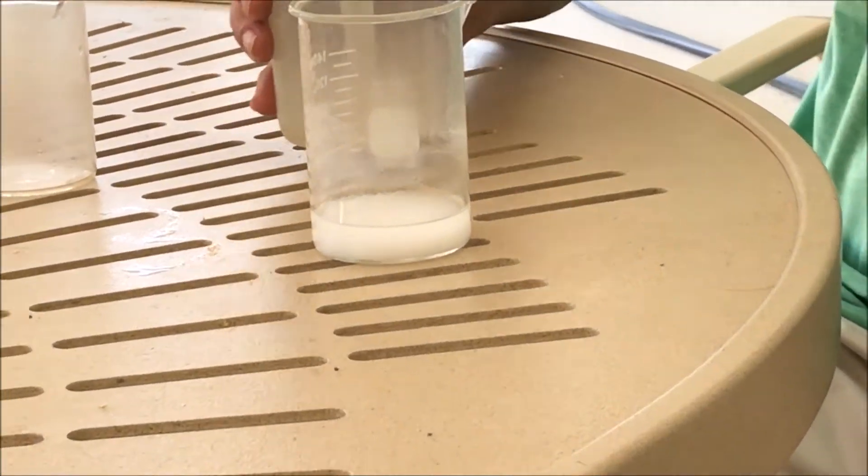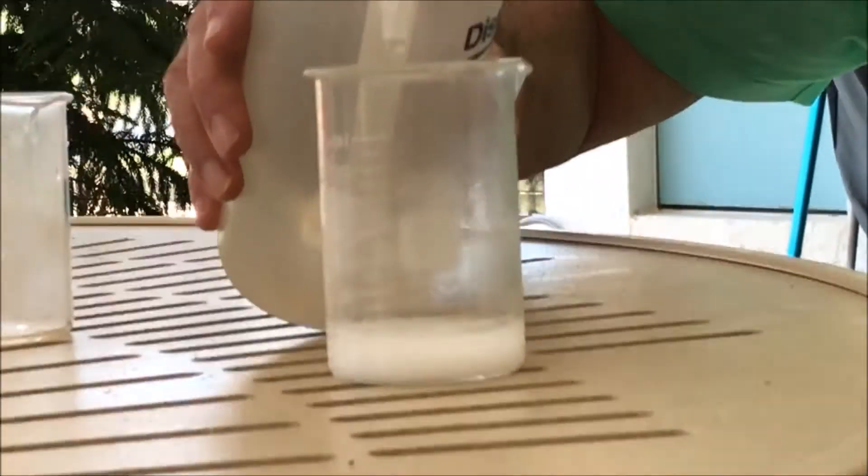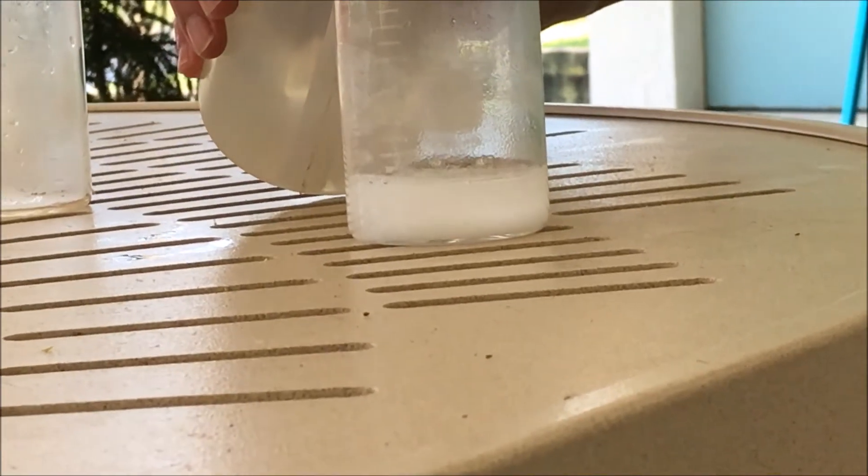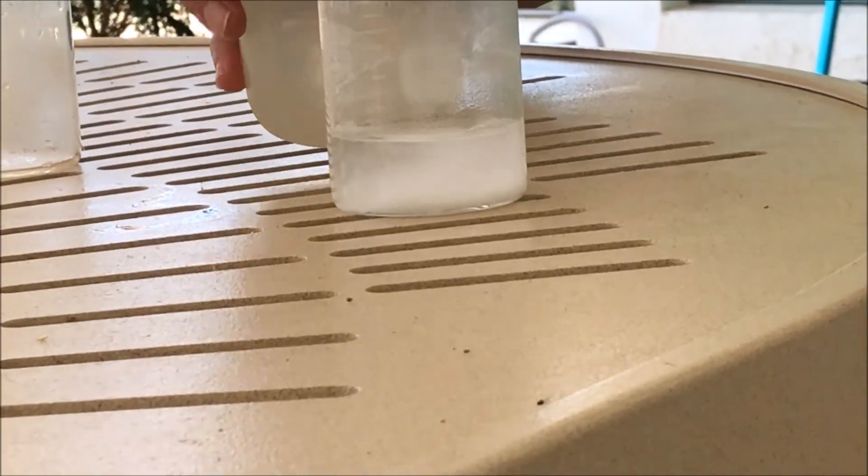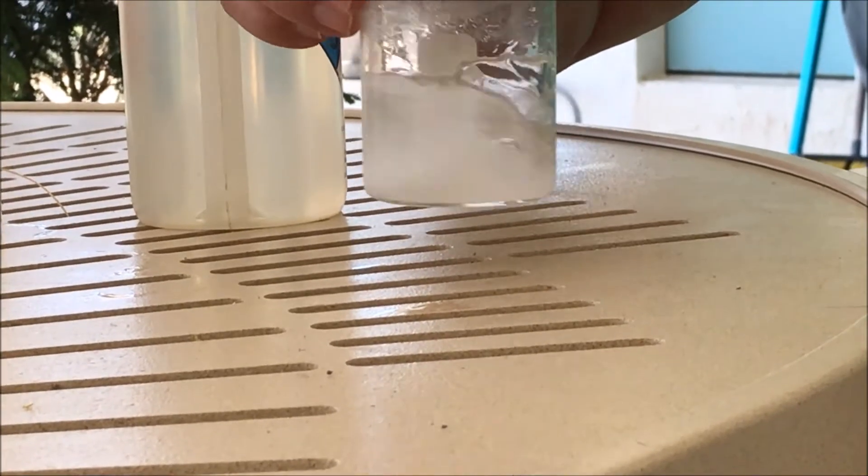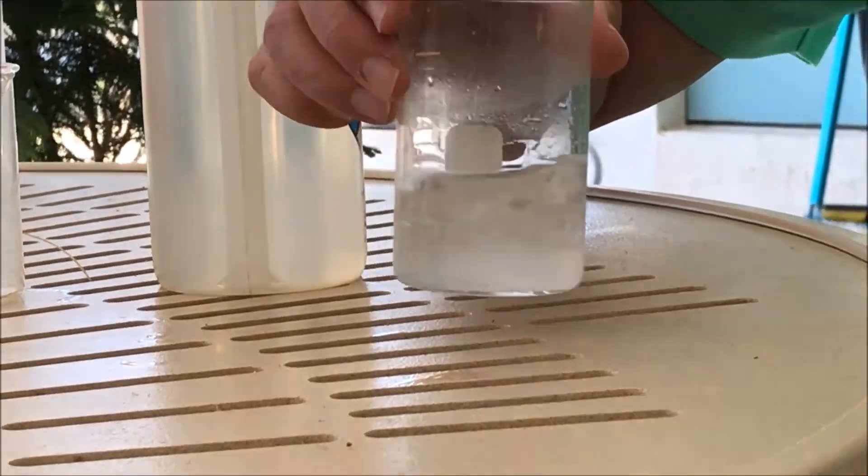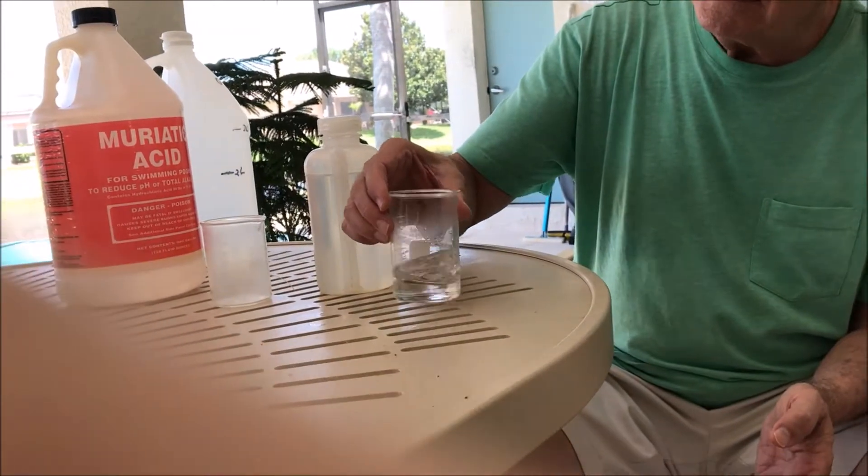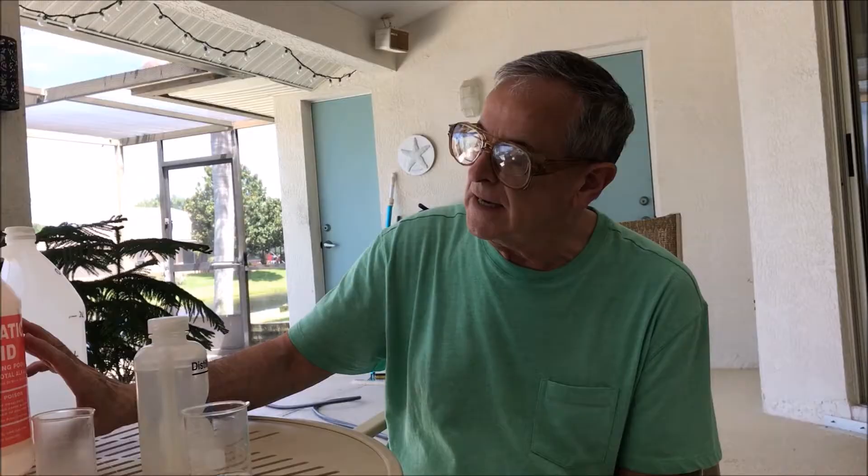I thought the sodium chloride would be dissolved, so I'm going to add a little bit of water to see if it does. I'd like to get it all dissolved. Probably because there was such a high amount of chloride ion, it wasn't very soluble. I have excess hydrochloric acid. Okay, so it's all dissolved.